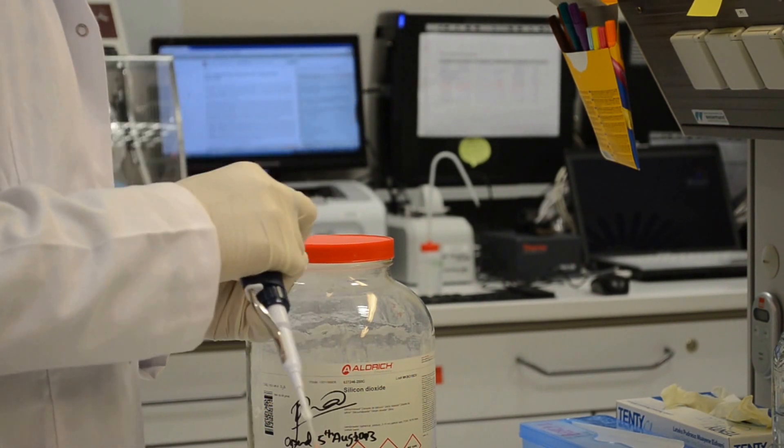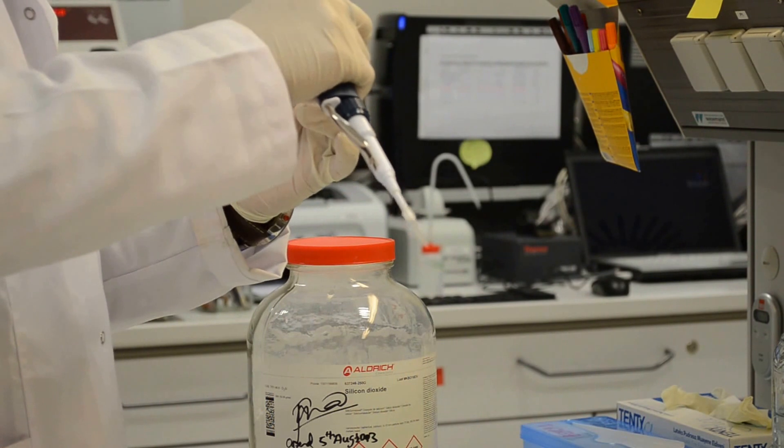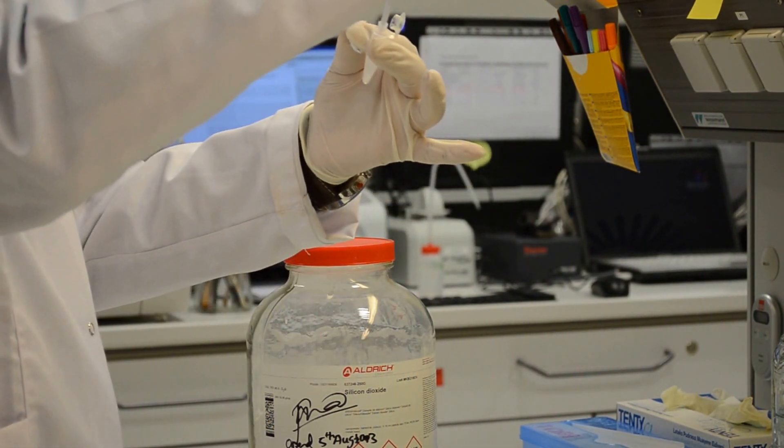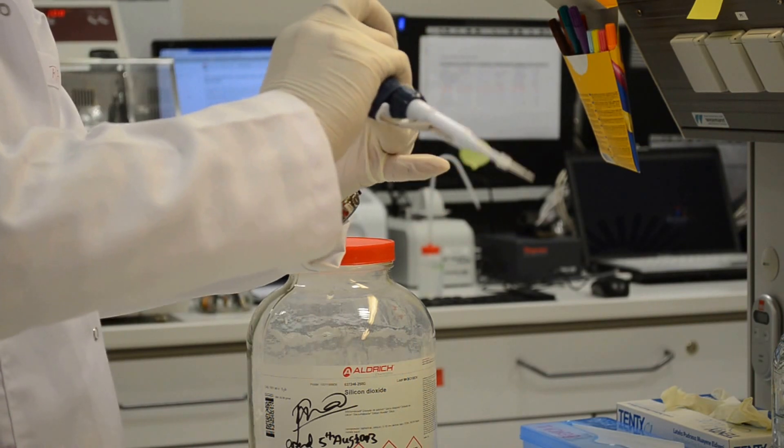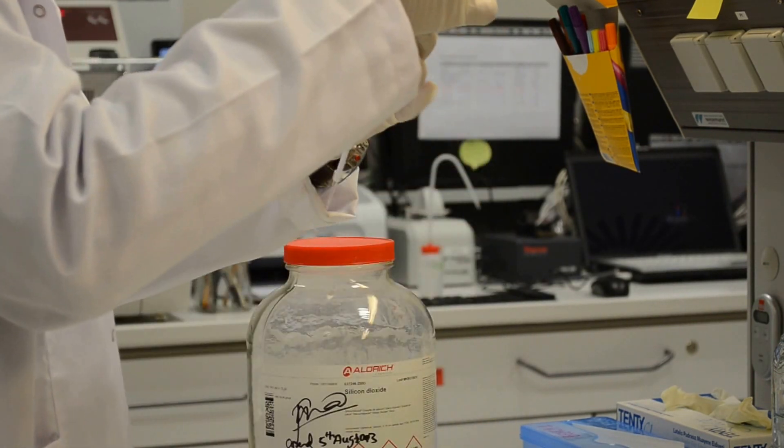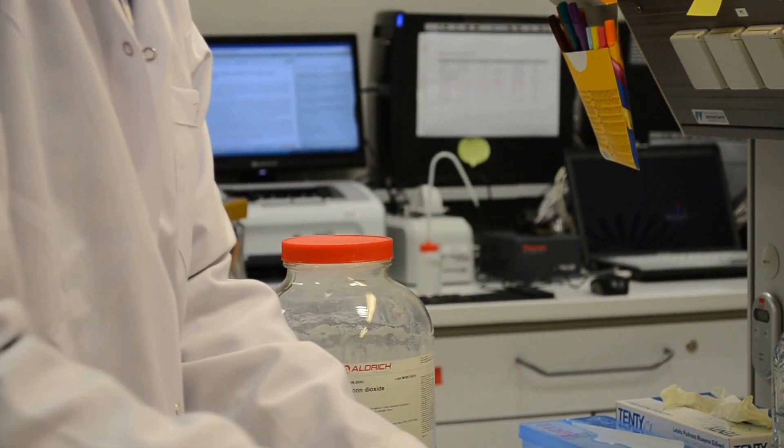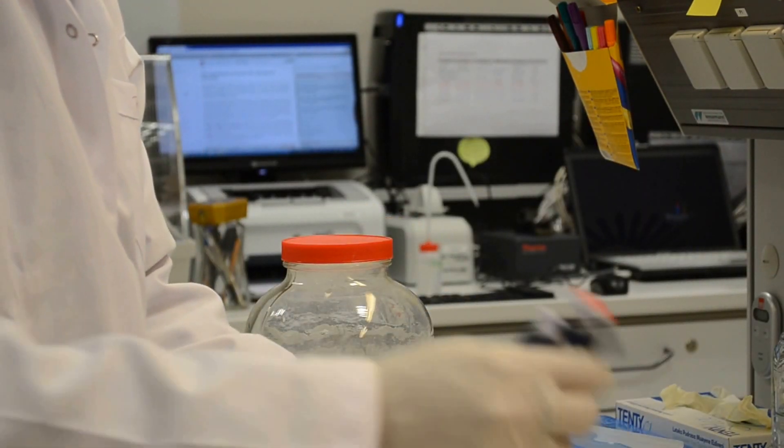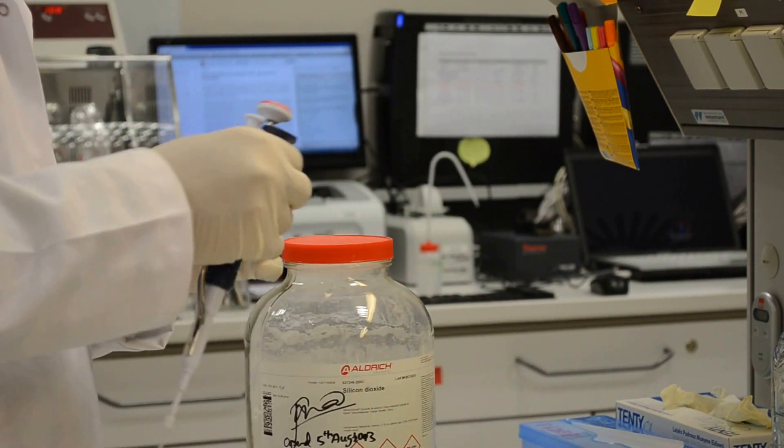A small quantity of diluted sample will be added to each of these tubes. One of them is the control. The main purpose of this experiment is to show the ability of our reagent to make the quantum dots go into the porous structure of silica particles.